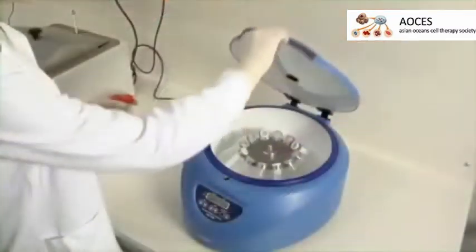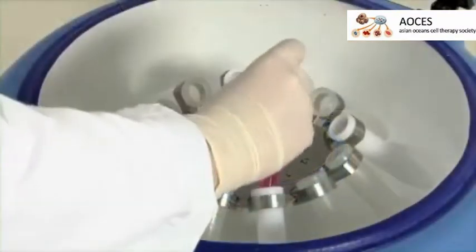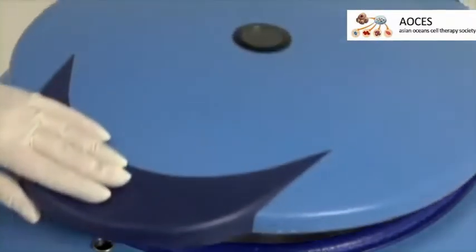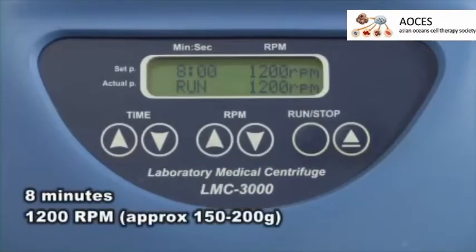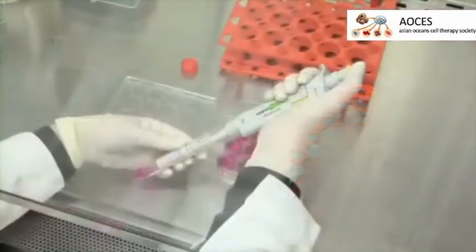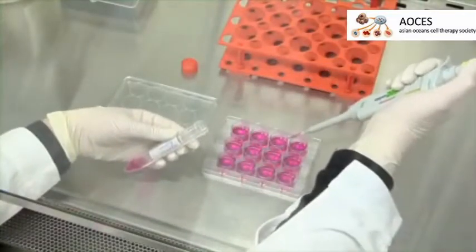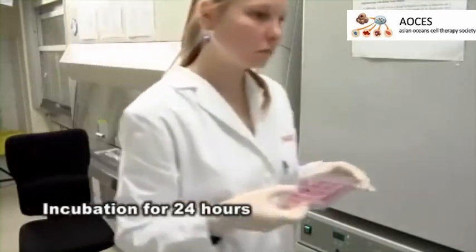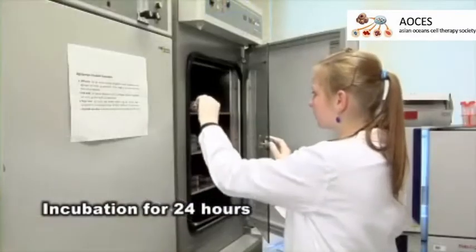After 30 minutes, at the end of the reperfusion, add 20,000 mesenchymal stem cells per well to the postischemic H9C2 cardiac myoblasts. The initial steps are the same as H9C2 seeding: washing 2 times with PBS, trypsinization, and counting. Place the co-culture of cells into the 37-degree carbon dioxide incubator for 24 hours.